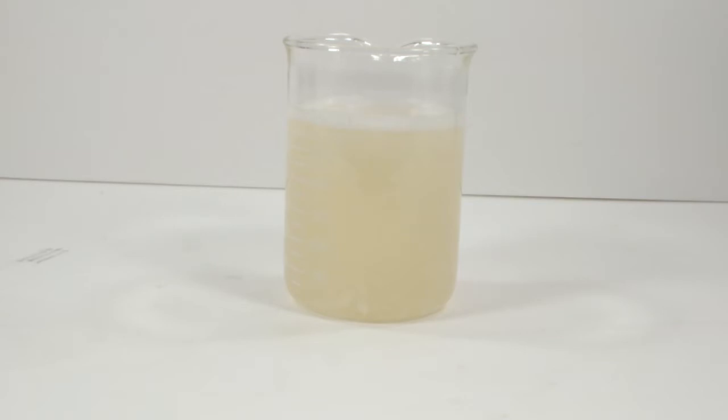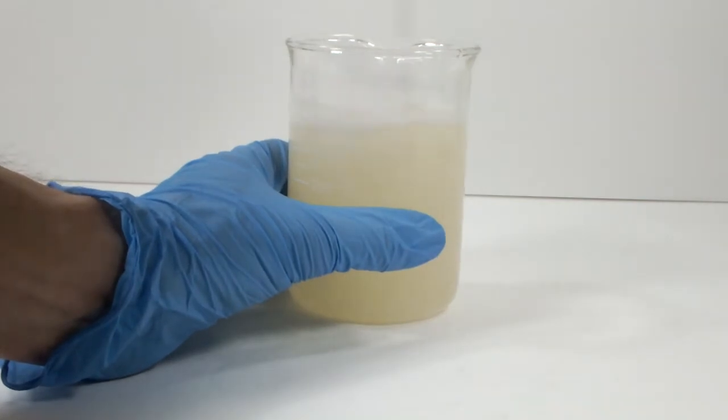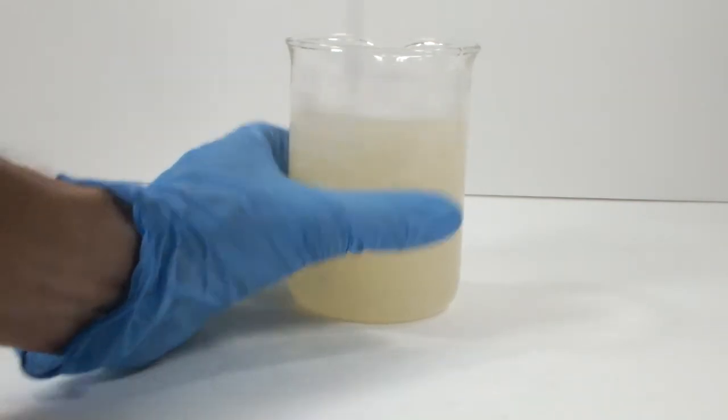First things first, let's fish out that stir bar. Oops, I guess the last solution I fished the stirring bar out of was phenolphthalein. I'm going to give it one last stir, and then before it sets up completely, we'll get it into that bottle.